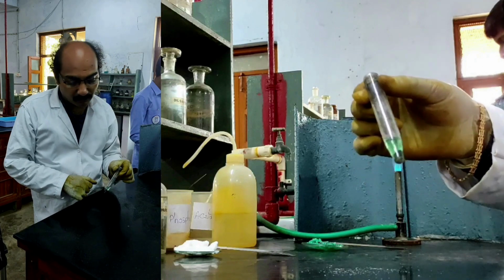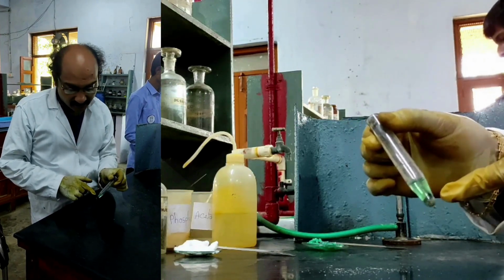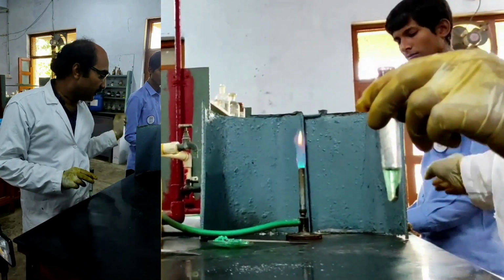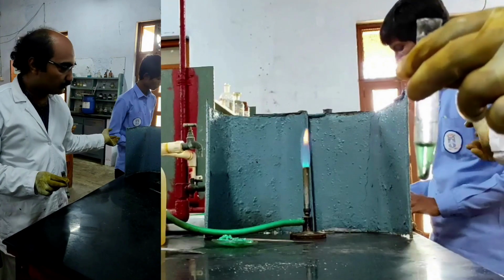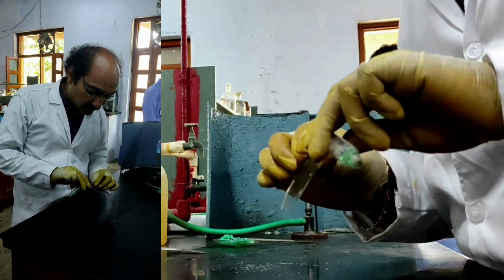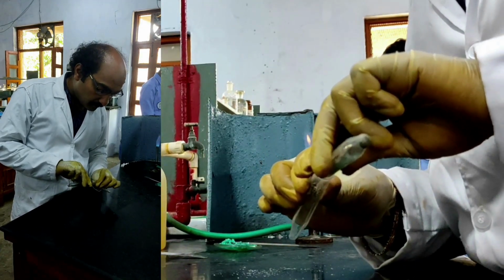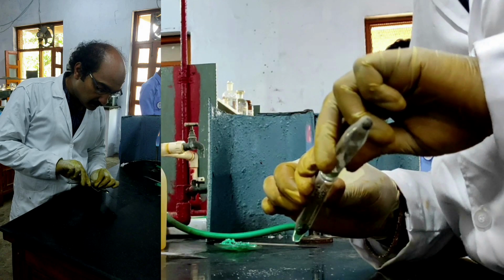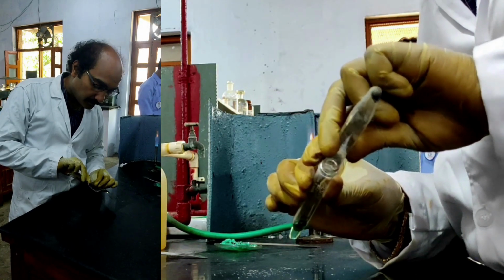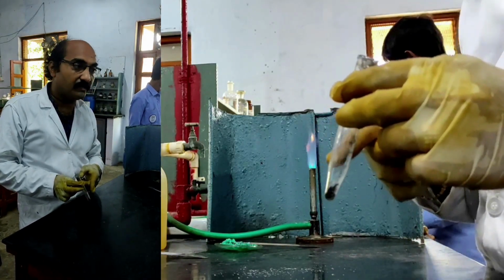Therefore, definitely this indicates the presence of nickel. Let us explore and confirm the presence of nickel 2+ in this precipitate. For that, what should I do? I should basically take another centrifuge test tube, and the centrifugate is separated. The centrifugate may contain manganese or zinc. The residue is to be tested for cobalt and nickel ions.